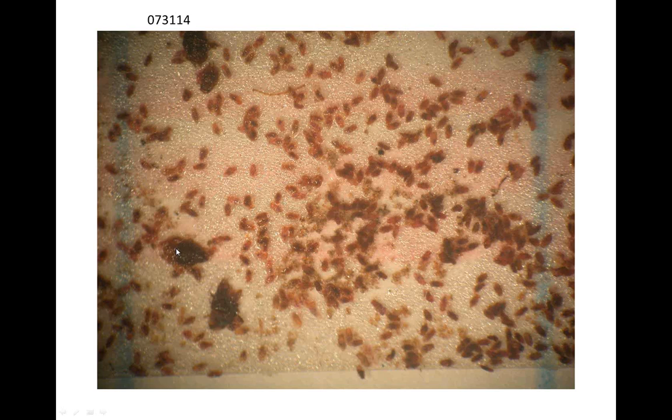These are much older, and the new ones are probably first stage crawlers that have come out from the first generation or so. Let's see, on the graph, these were actually 3rd generation. The 3rd peak.